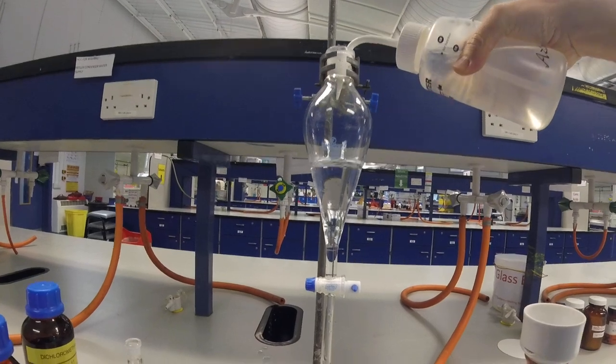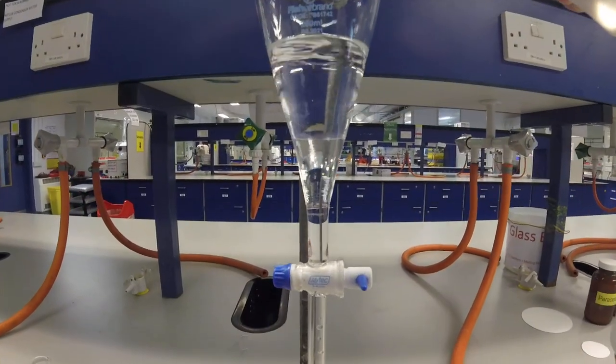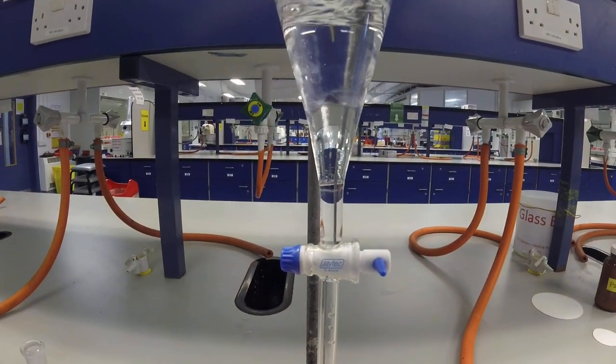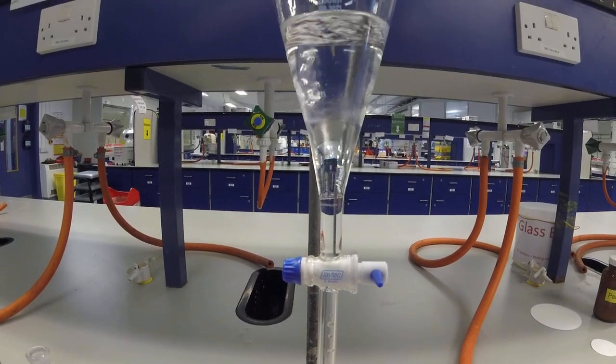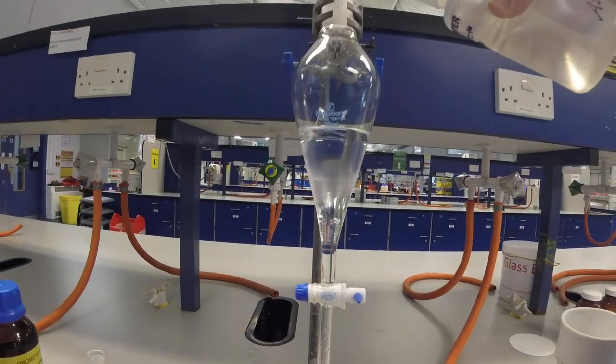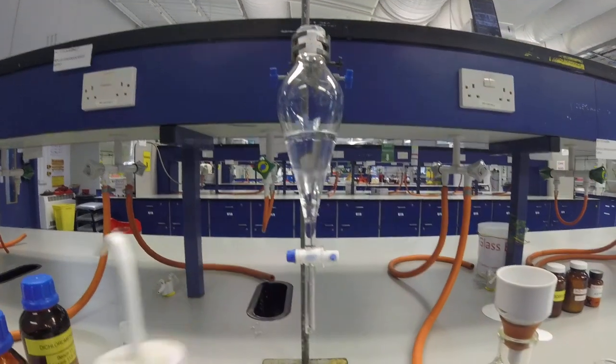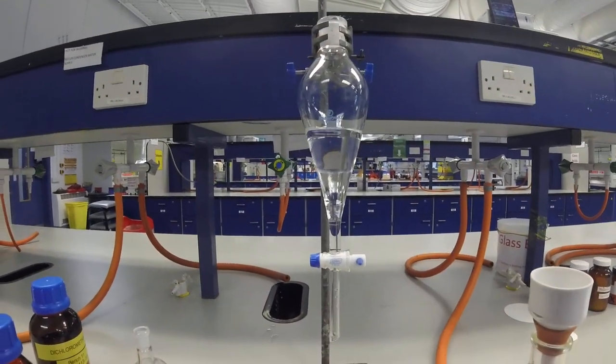And as you can see, as you add water, it drips in through and goes to the bottom. And that's because with a liquid-liquid separation, the different layers, if they're immiscible and they don't mix, will separate according to density.